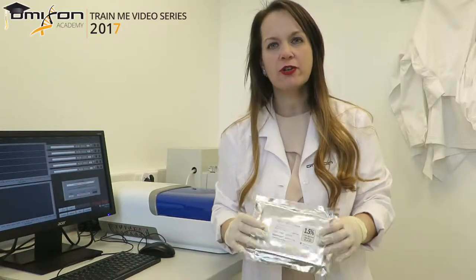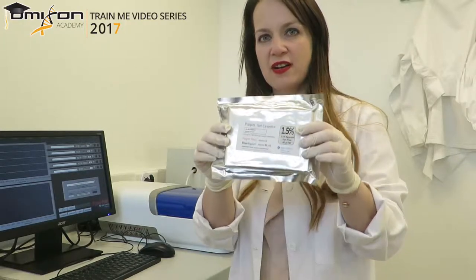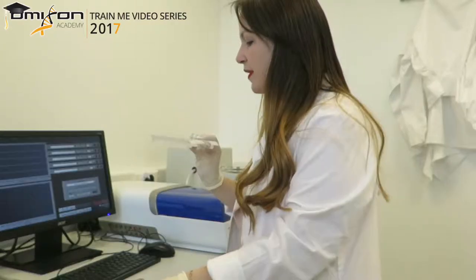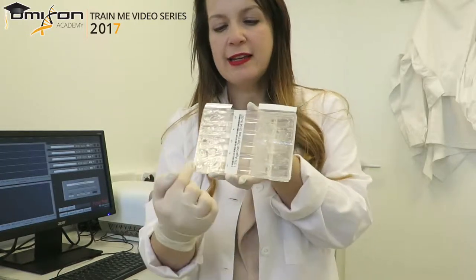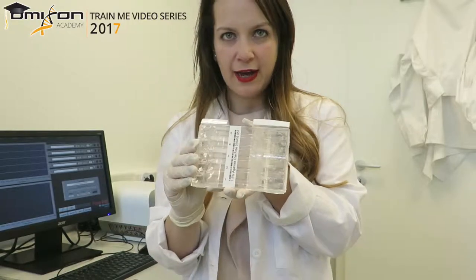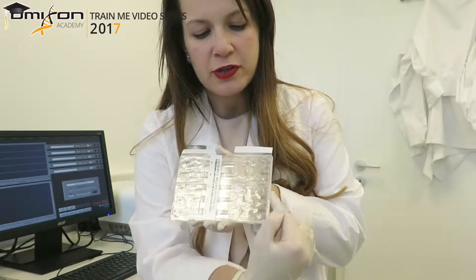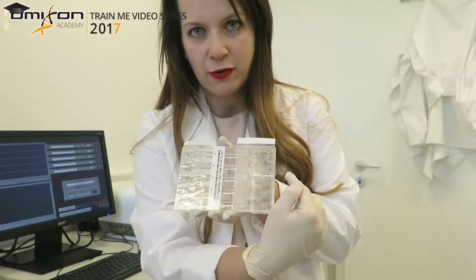Now that calibration is finished, we are ready to test our cassette. We are using the 1.5% dye-free cassettes with internal standards, meaning the fluorescent standards are mixed with the library and loaded all in one lane. Each cassette has five lanes, each numbered one through five. Each lane is essentially one column filled with agarose gel that branches into two about halfway down. There are ports for negative electrodes on one side and ports for positive electrodes on the other — two ports per lane for the positive electrodes.